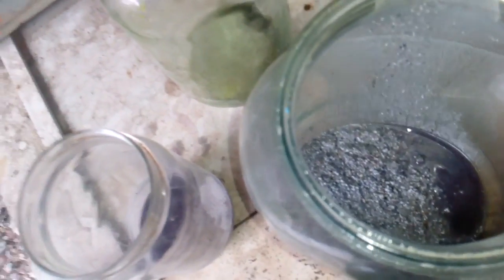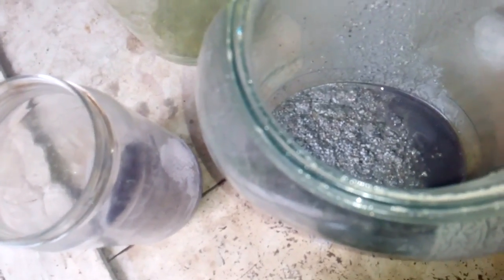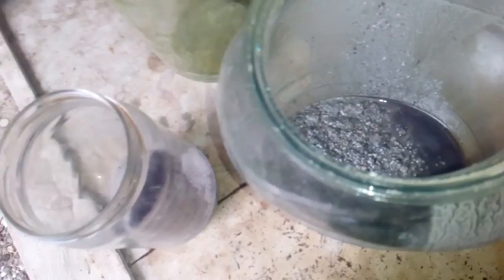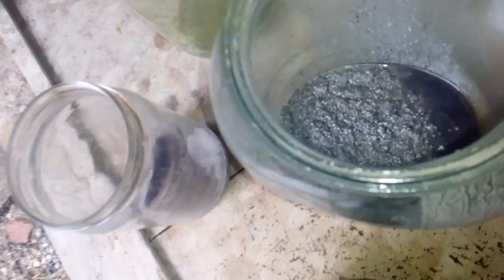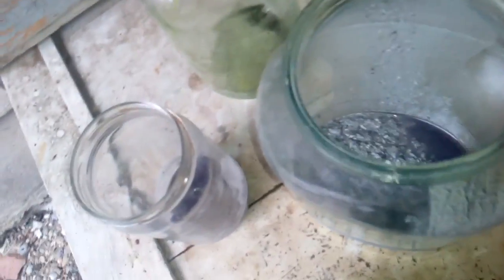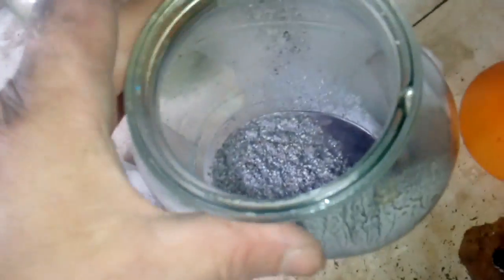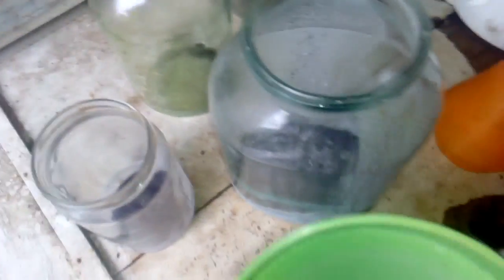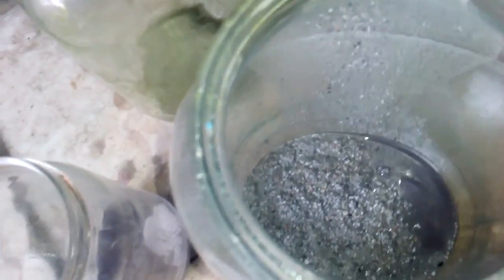And leave, I hope, only palladium. So what we need, what we need to do is wash that slag several times and remove all that HCL. Okay, I washed that several times but we still got some silver chloride inside. I think I remove every HCL, but maybe if stay some inside, not make such a big problem.